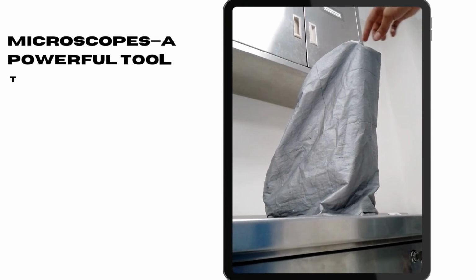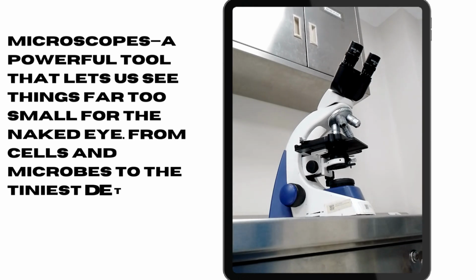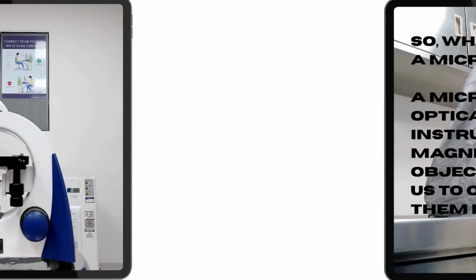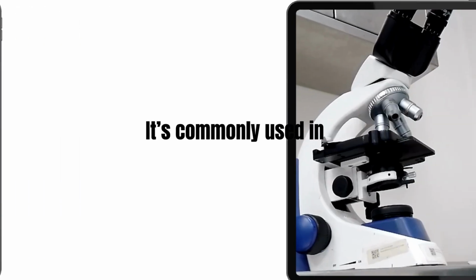Microscopes, a powerful tool that lets us see things far too small for the naked eye. From cells and microbes to the tiniest details of tissues, the microscope plays a key role in science, medicine, and education. So, what exactly is a microscope? A microscope is an optical instrument that magnifies small objects, allowing us to observe them in detail.